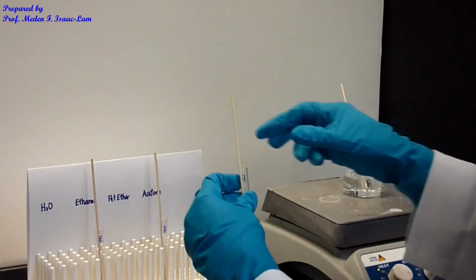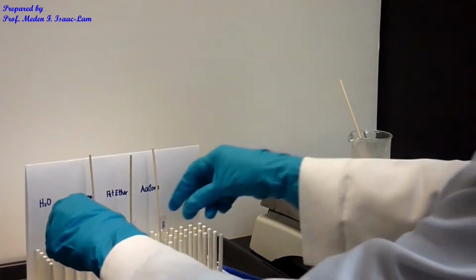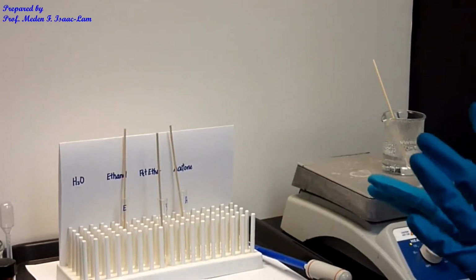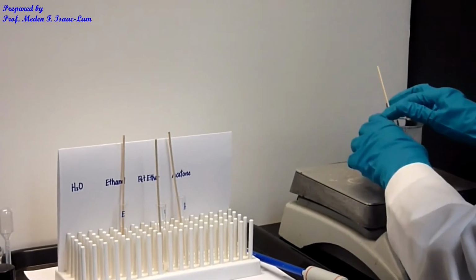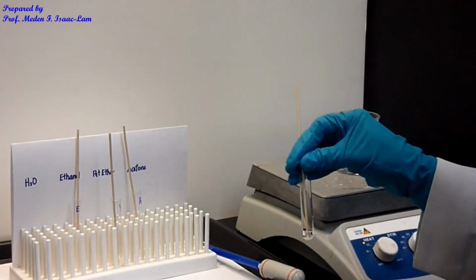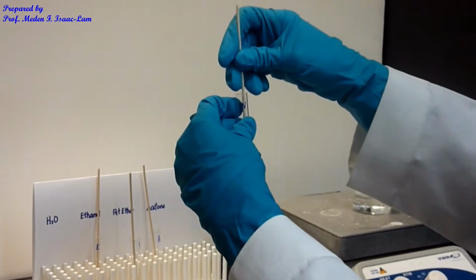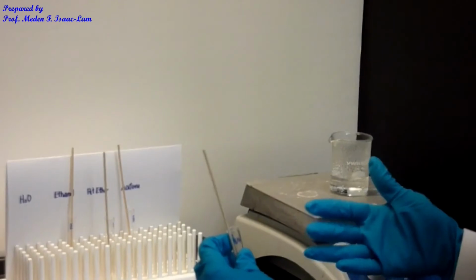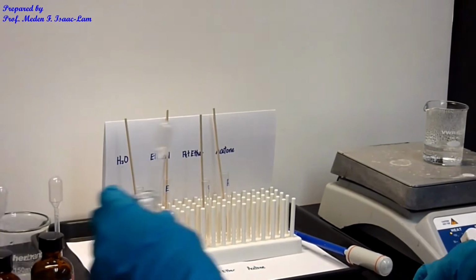So I might have to add more solvent. I'm gonna put the ethanol and acetone to the back because I'm done with it. I don't really have any reason for that to be heated up because it's already dissolved at room temperature. However, for these 2 samples I need to now see what I can do, right? Because it feels hot and I still have some solute at the bottom, I'm going to add 10 more drops of the water as well as the petroleum ether. And then I can make a comparison, almost the same level of the solvents.